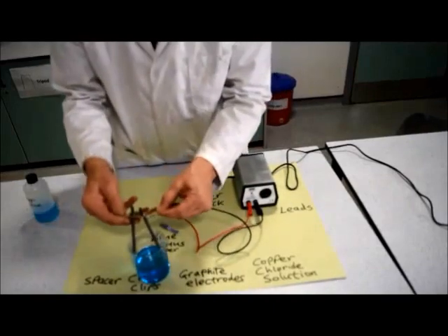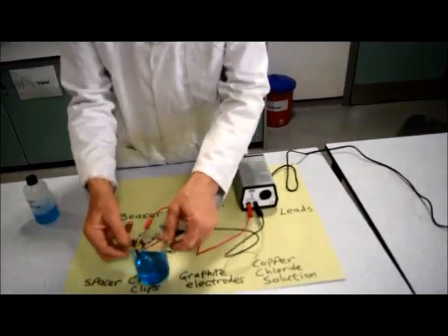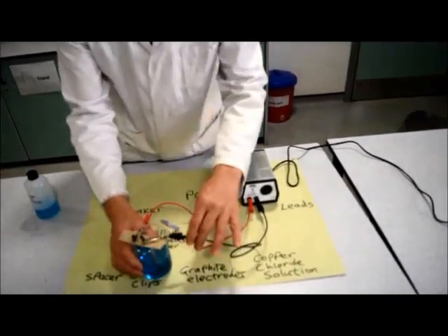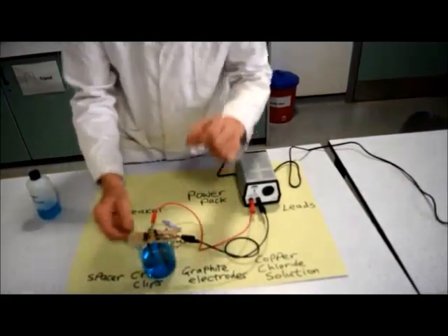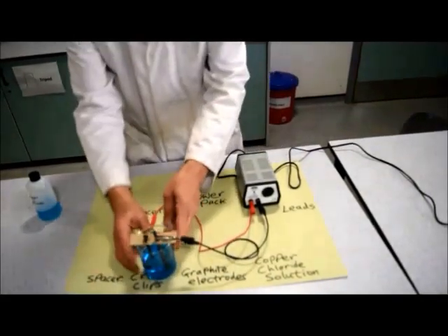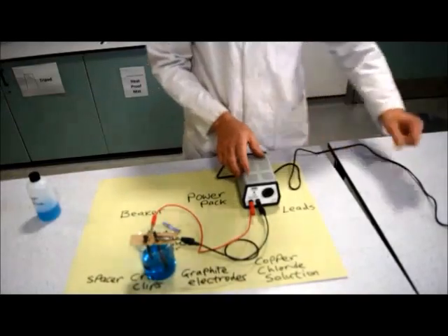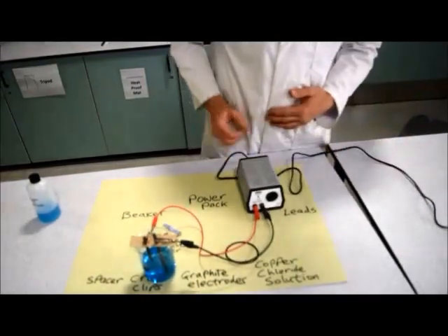All we do is put it into the solution like that, making sure that the electrodes are apart. Now we are ready to turn on the power.